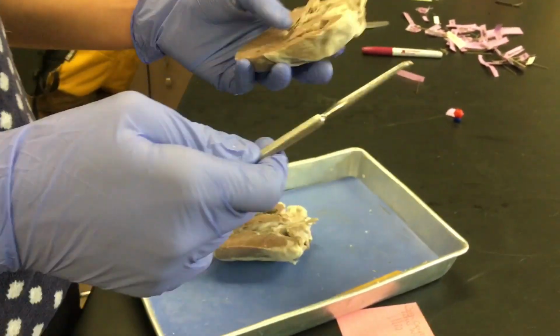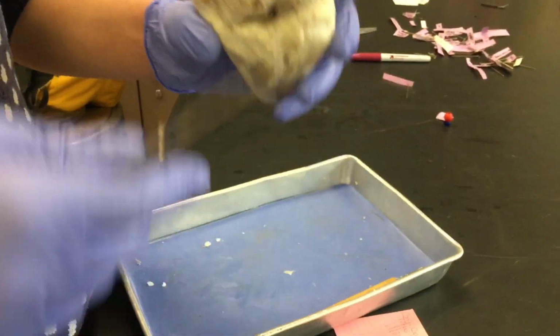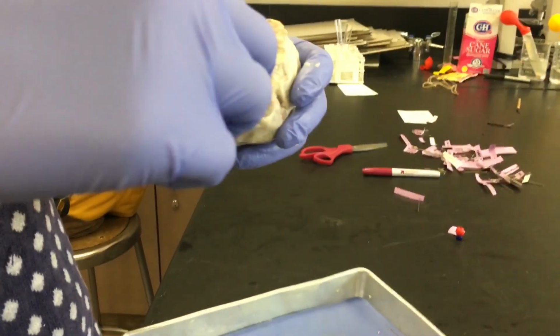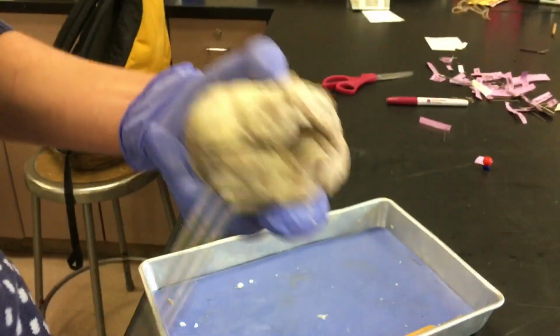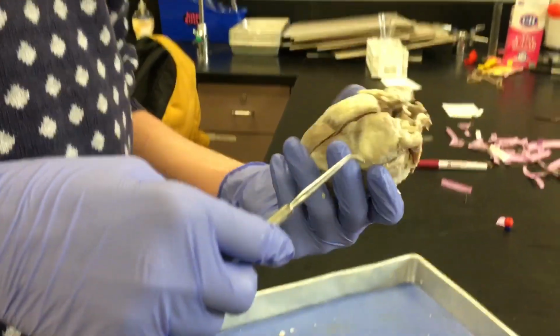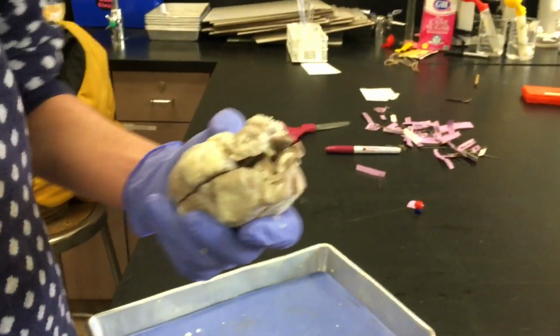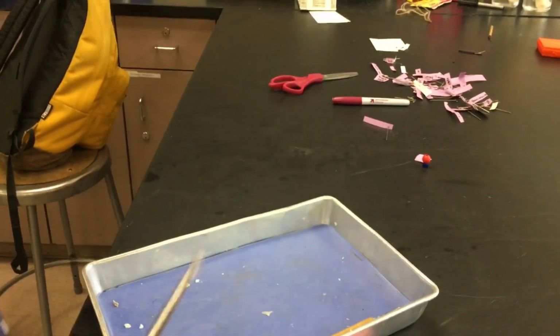And there's also this thing called the brachiocephalic artery, and it's connected to the aorta, but you can't really see it here because there's nothing really connected to the aorta, but it's there. It's used to send blood to the arms and the brain, because brachiocephalic.